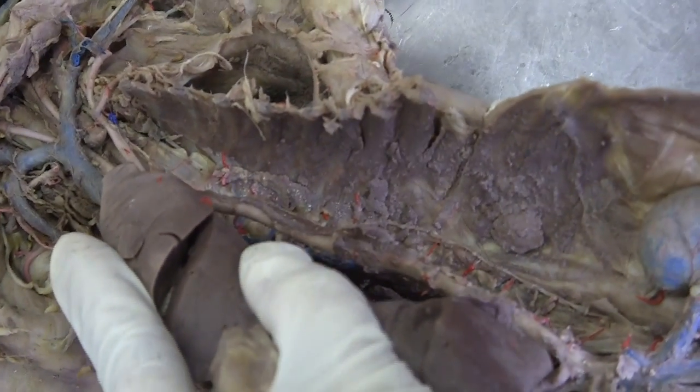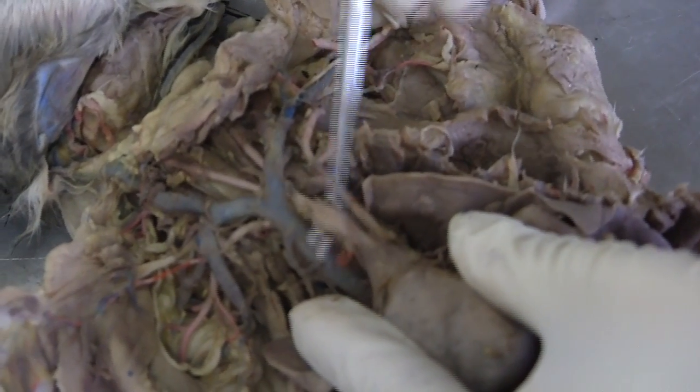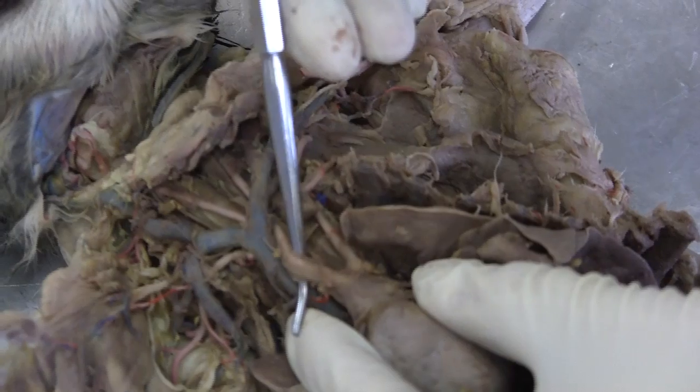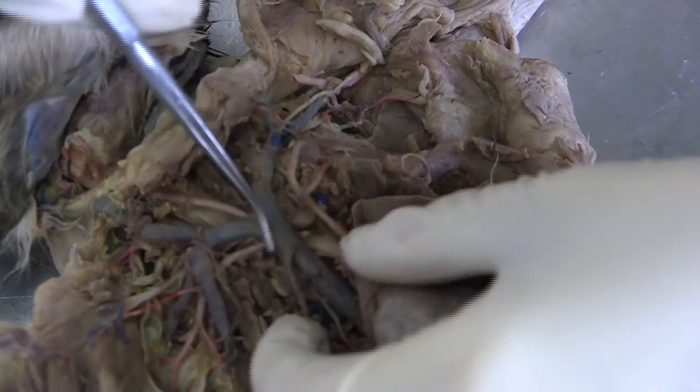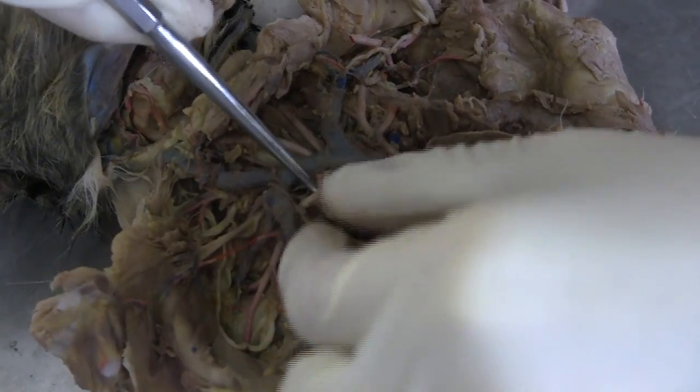Descending aorta right here. And the brachiocephalic artery is the branch from the aorta — the middle one. From the brachiocephalic artery, keep going to the right — it's the same here. So this part is the right subclavian.